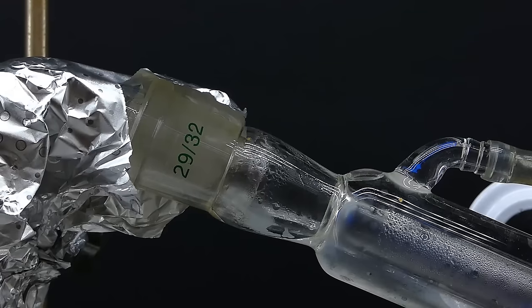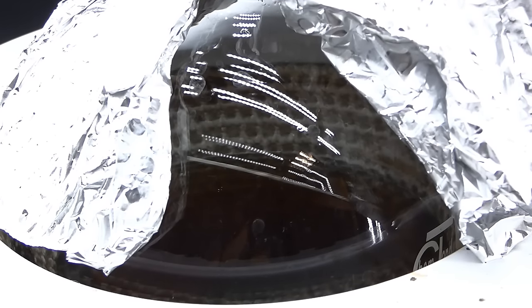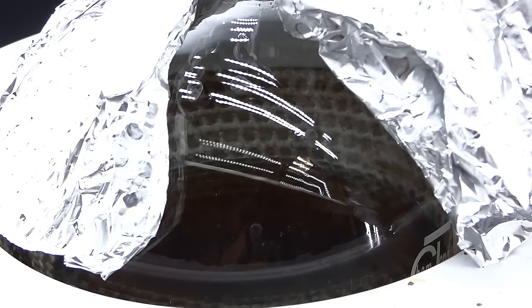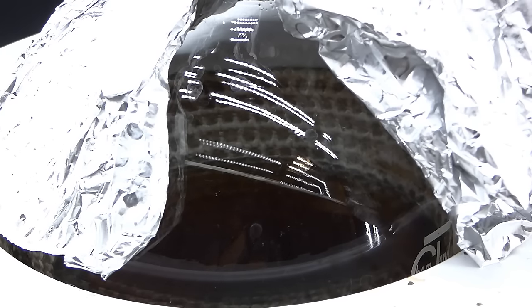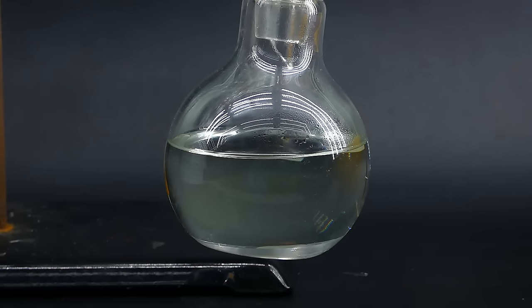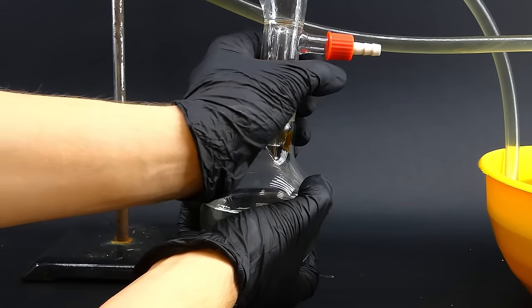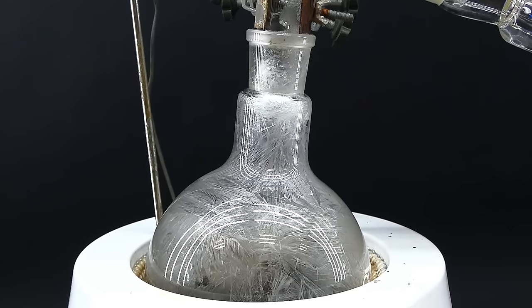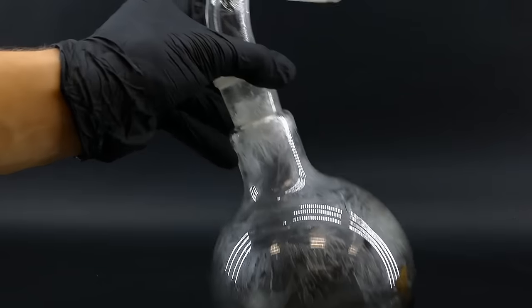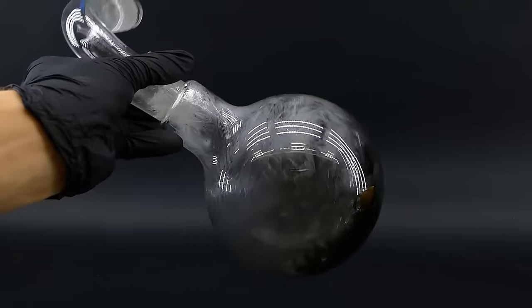Some of the sublimed adipic acid also ended up in the condenser, contaminating my cyclopentanone, which I will need to remove later. As the distillation went on, the boiling mixture started turning into yellow tar, which will be a recurring theme throughout this whole project — in organic synthesis, you just can't really do much about it. In the receiving flask, the water formed a separate layer below the cyclopentanone, and after 9 hours, when no more distillate was coming over, I stopped the distillation and collected my product. Some adipic acid still stayed in the boiling flask as nice needle-like crystals along with some disgusting barium tar, which was a nightmare to clean.